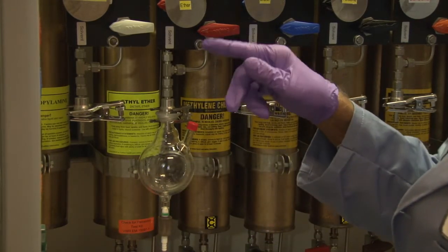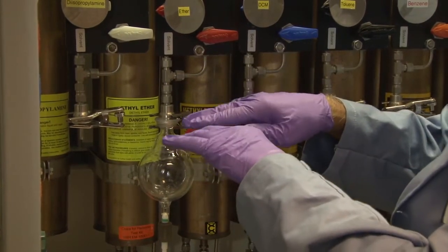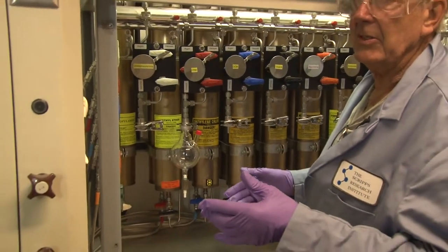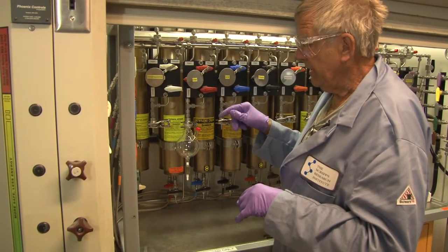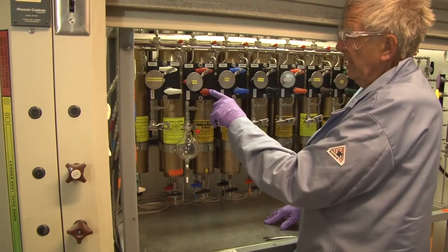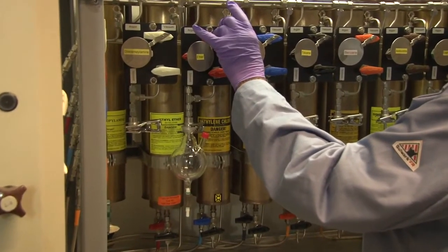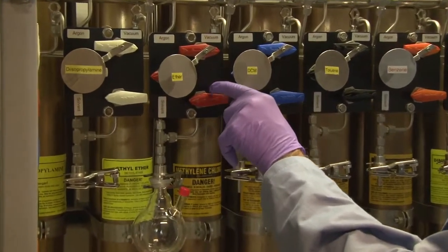As a matter of fact, if the pressure on the system is set too high, the clamp has enough give — it starts to leak and float — which is a design safety feature. You just run out of argon before you want to. This system has no solvent at this point, but I will explain the operation. This valve separates this volume from either solvent, vacuum, or argon — wherever this points, that is what you get up to this valve.